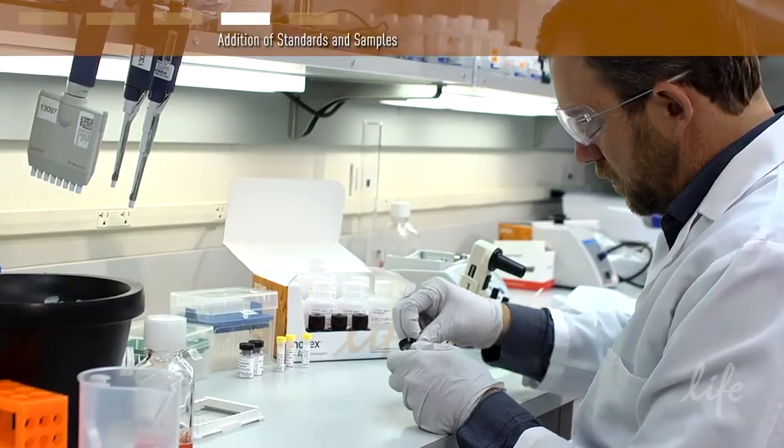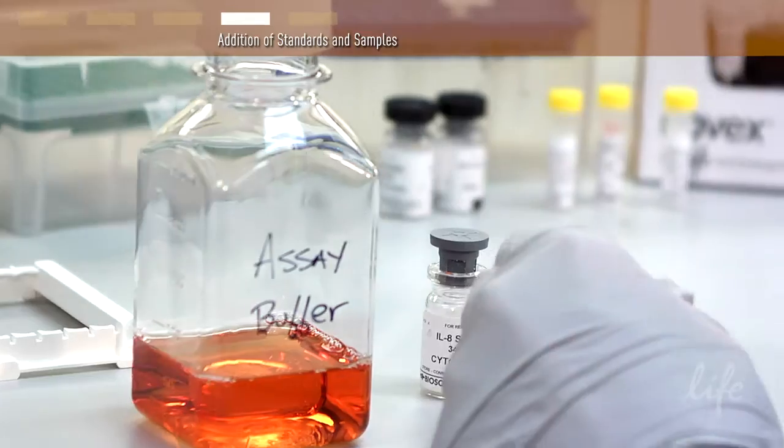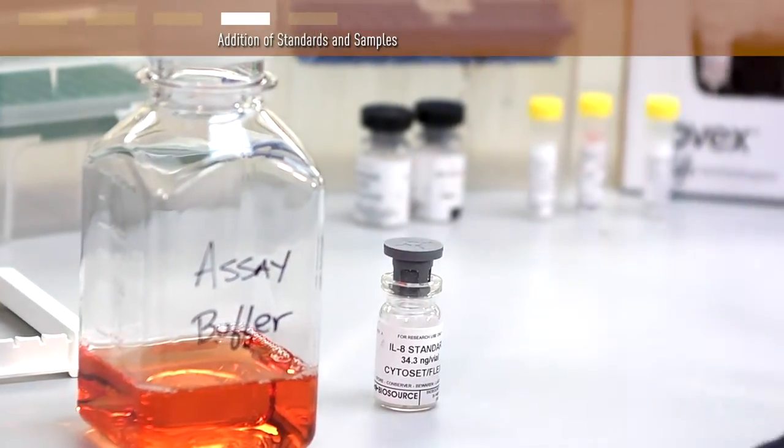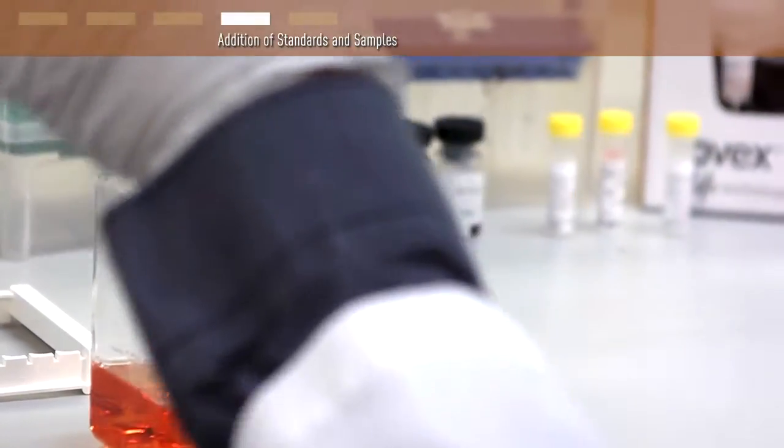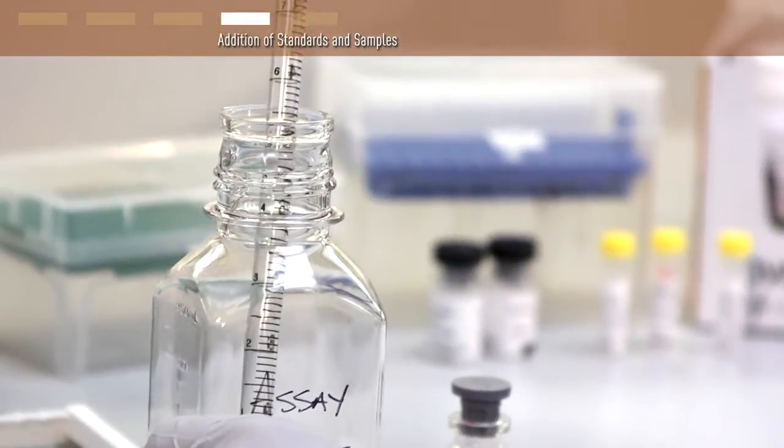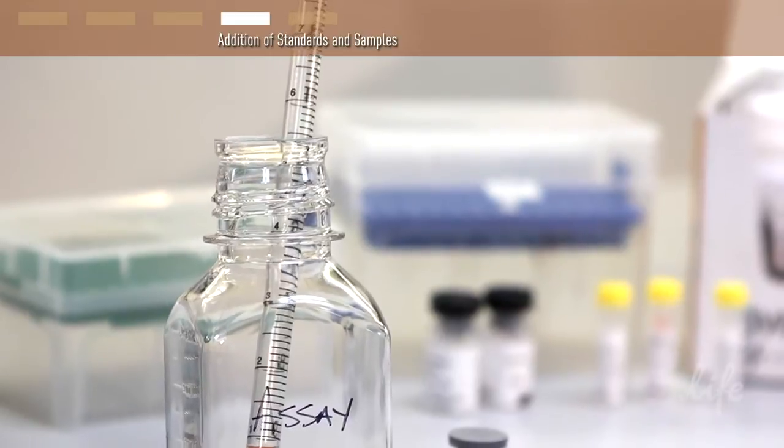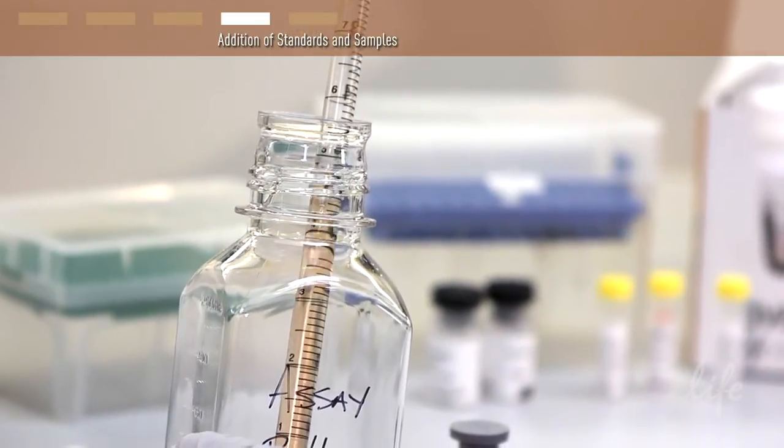A standard protein should be reconstituted to the concentration recommended in the technical data sheet with the recommended assay buffer or a buffer of your choice. Allow 10 minutes for rehydration of the standard.